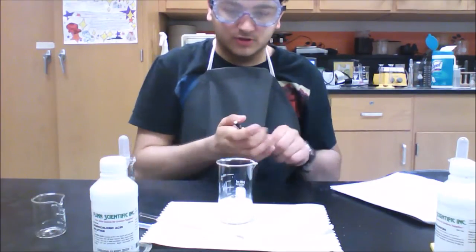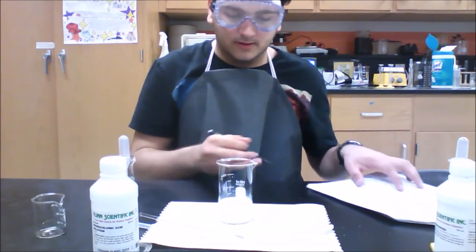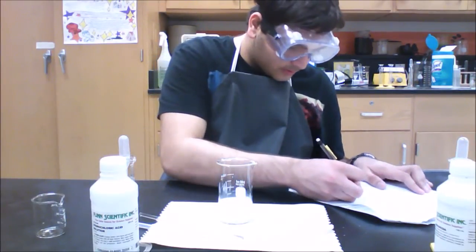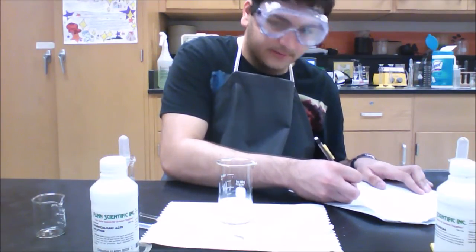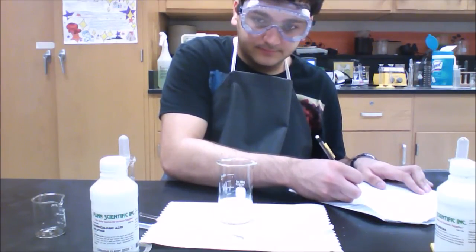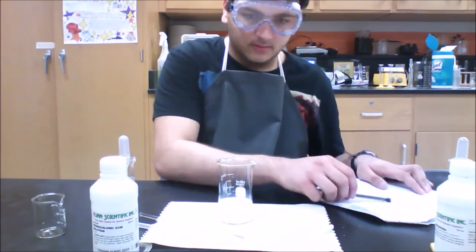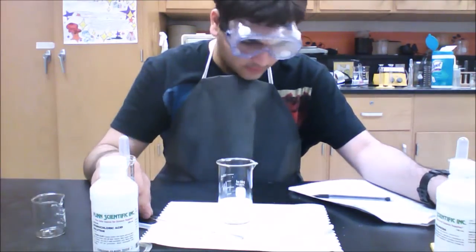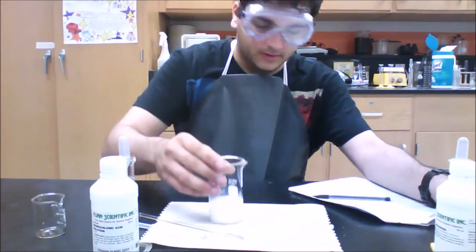So make sure to keep recording all the colors of all your solutions as you're going through this process. So your milk of magnesia was white, and now you just have your distilled water, which is obviously clear with no pH or anything. So after you've stirred it, it's still a milky white color.